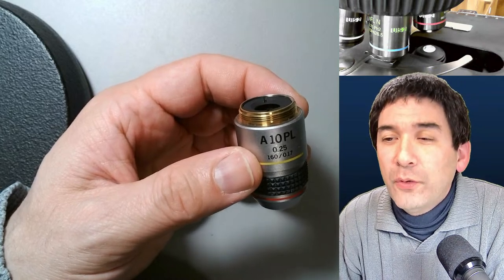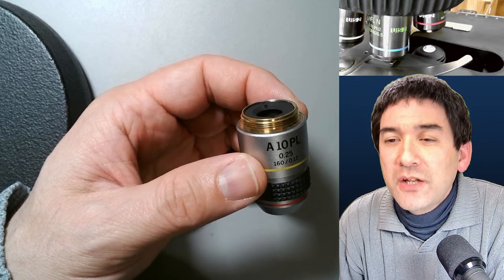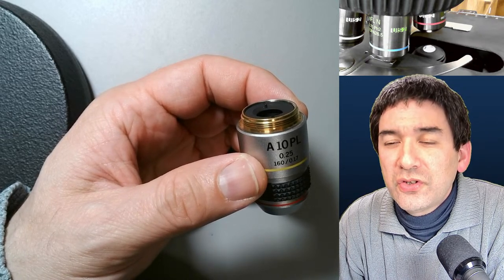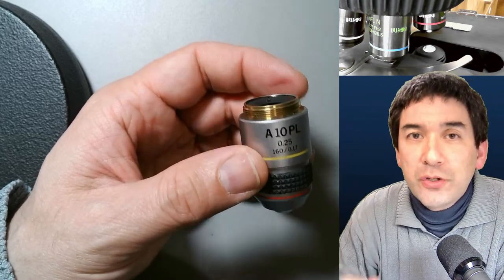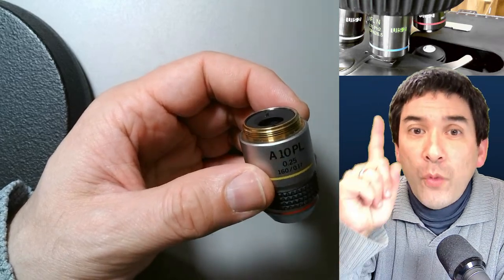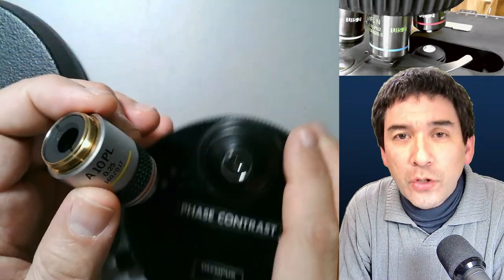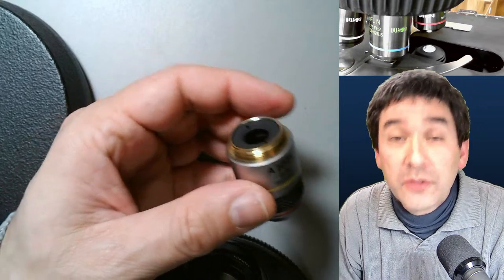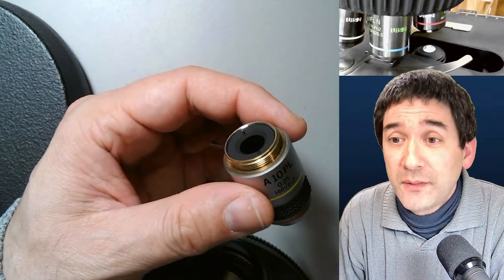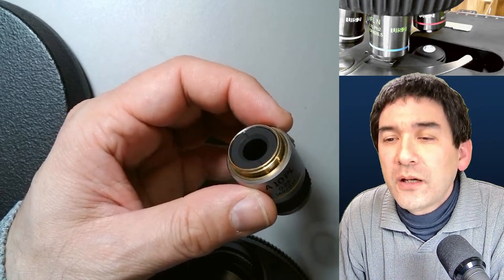Regarding the DIC upgrade question: the microscope on top uses differential interference contrast. I also have one phase contrast objective mounted on it. The separate parts you see here are from a different microscope — I bought those parts second-hand on eBay and upgraded one of my other Olympus microscopes to phase contrast.